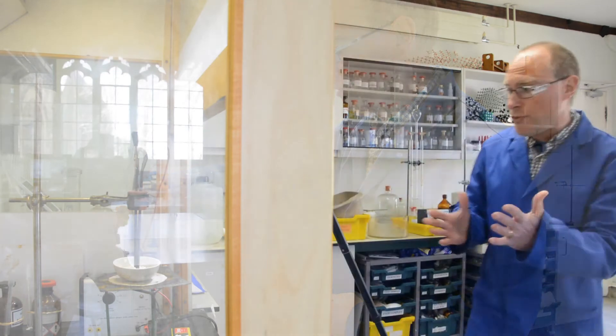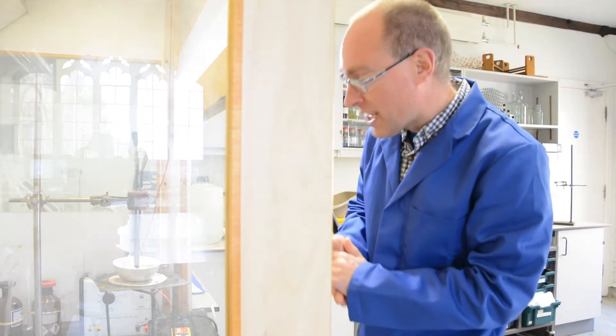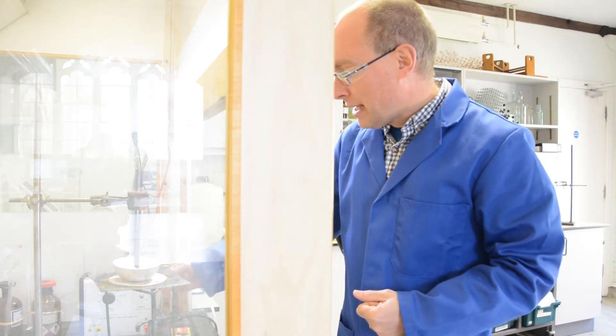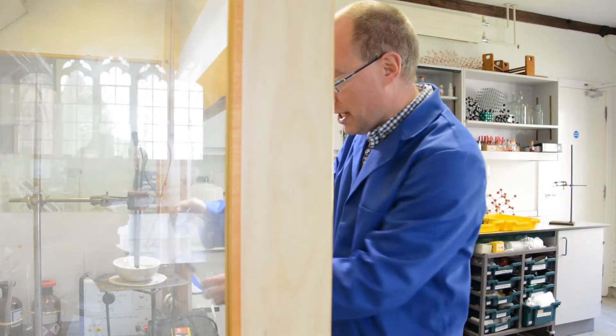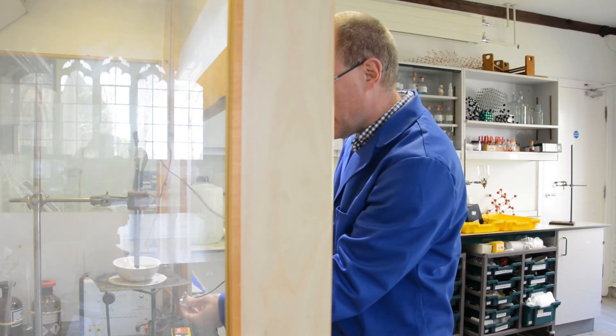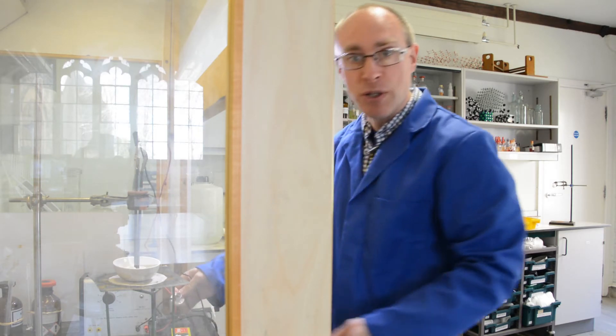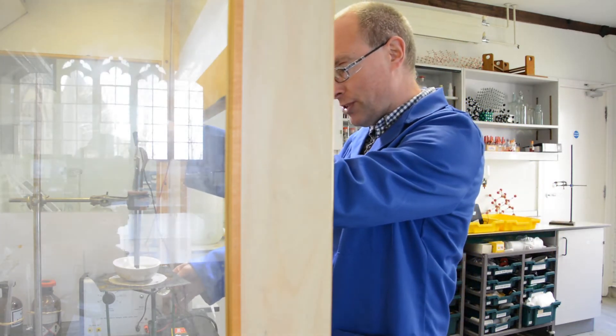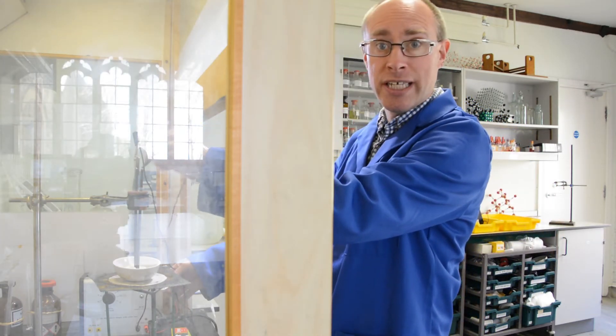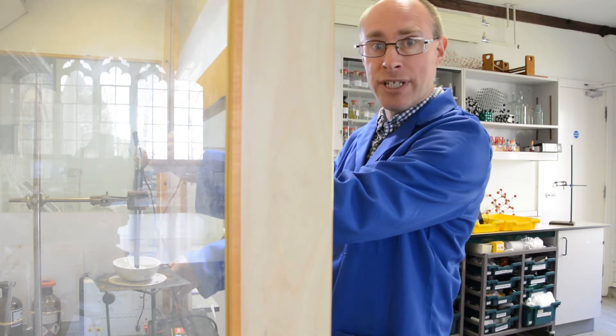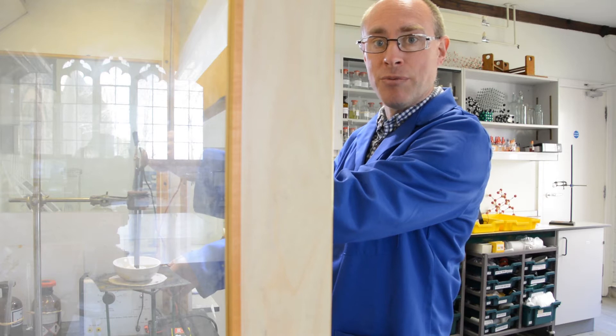First of all I'm just going to test its conductivity, and at the moment there is an electric current being passed through it and the light bulb has not lit. Just to prove that the circuit is working, I'll just complete the circuit and the light bulb lights.